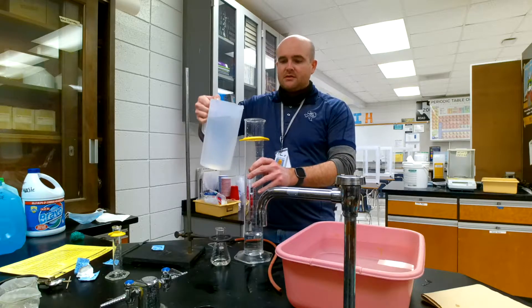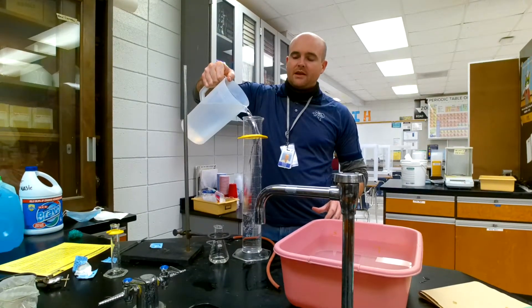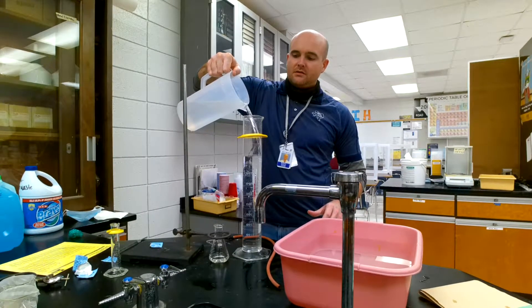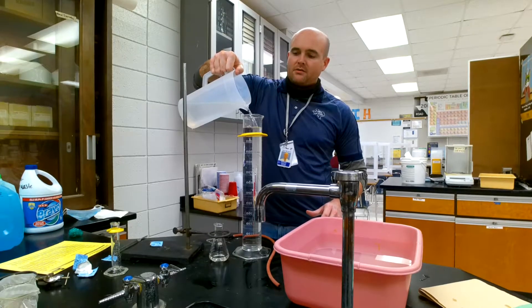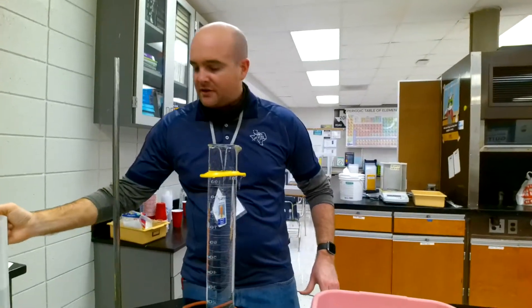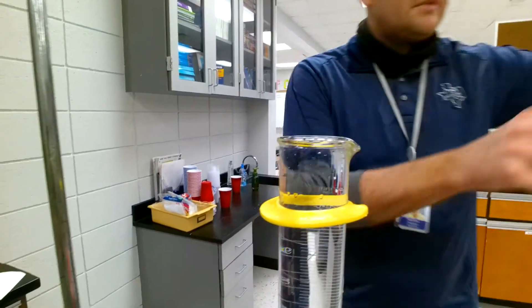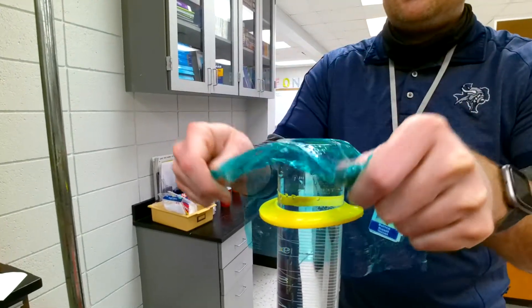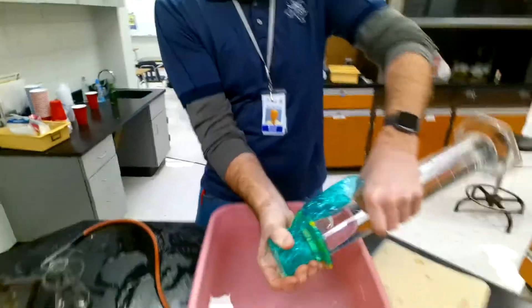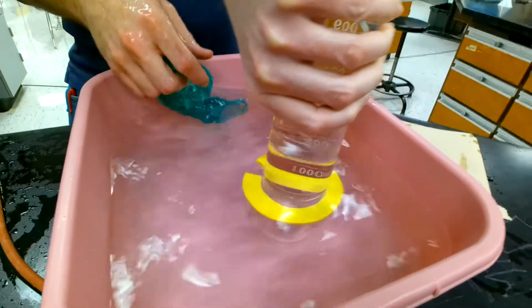So this is going to be my gas collection apparatus. I'm going to add in one liter right here, all the way just right up to the top, and to even where it goes a little bit over. I know it's a little bit messy, but that's okay. And then we're going to put saran wrap on the top so it's easier for me to turn it over, and then we're going to upend it right into there.